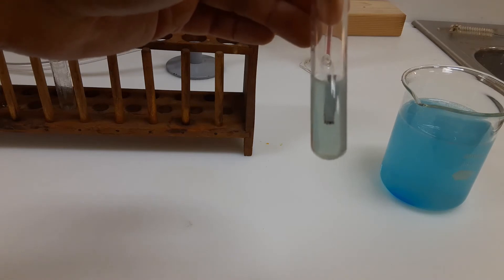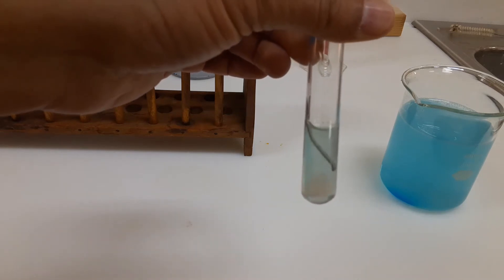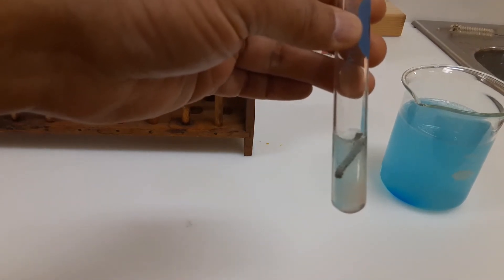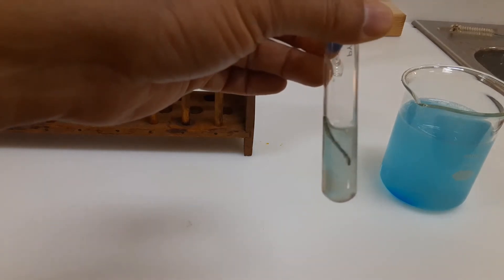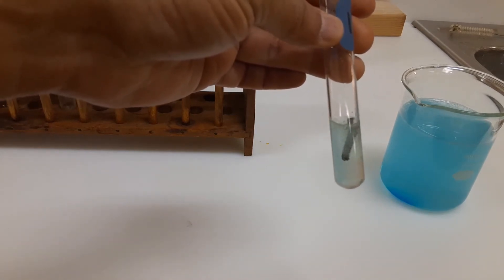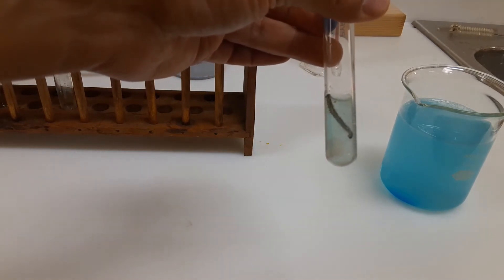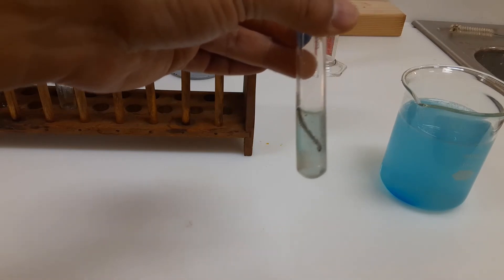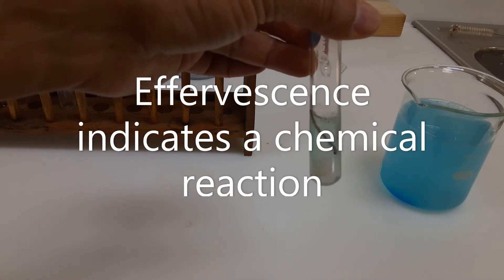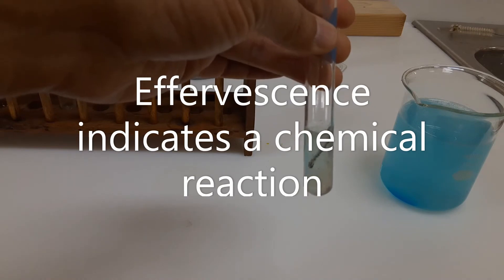When you see a chemical reaction in a mixture, one indication is the production of bubbles. In chemistry, we don't call them bubbles — we use the word effervescence, which starts with the letter E. Effervescence means that bubbles are formed inside a liquid and then rise to the top. The magnesium was at the bottom, and because of those bubbles of hydrogen, the magnesium has risen up to the top. So one indication of a chemical reaction is effervescence.